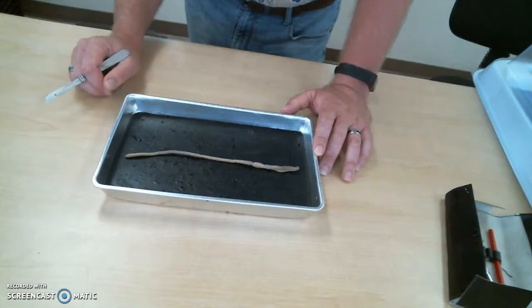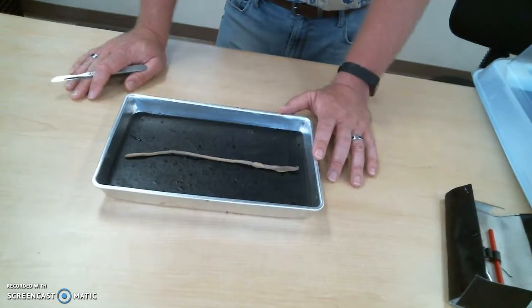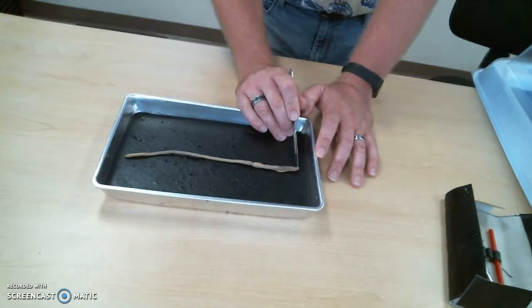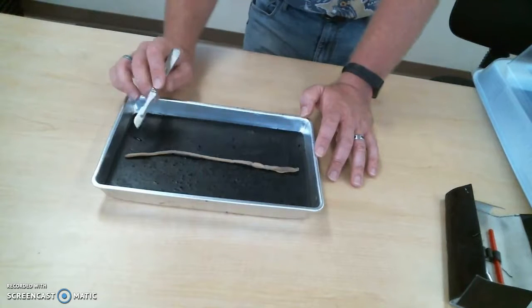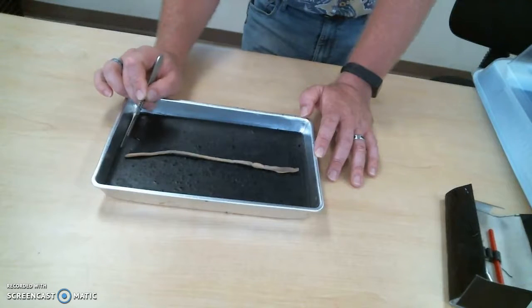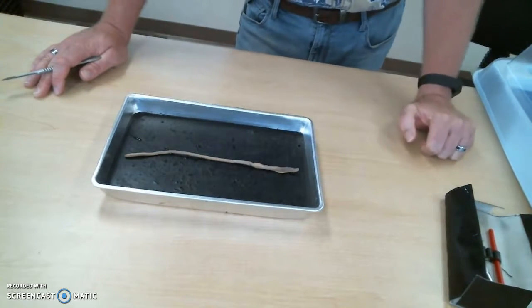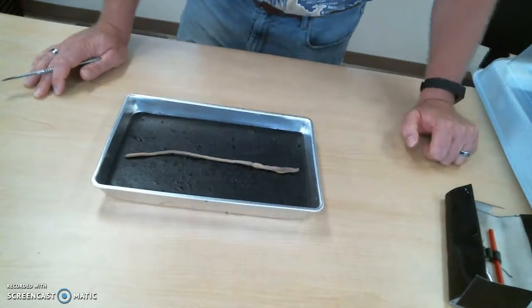Okay, cool. Does this animal have a complete digestive system, or is it a blind sac? Complete digestive system, which means it has a mouth and an anus. The mouth is up here at the anterior terminus, the front end or head end of the animal, and the anus would be back here at the posterior end. When we cut into it, the segments are all defined by muscle walls. What are those muscles called? The muscle walls that determine the different segments. Septae. Good job. Those are septae.